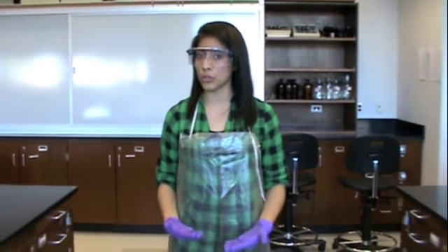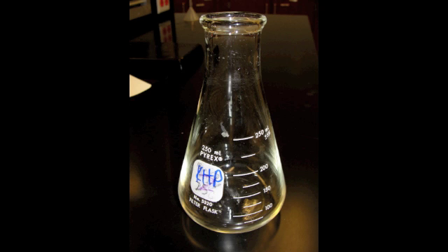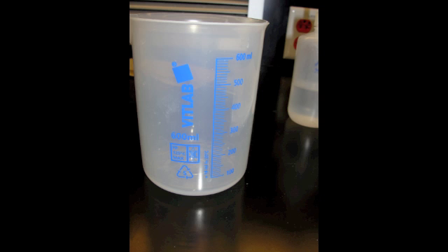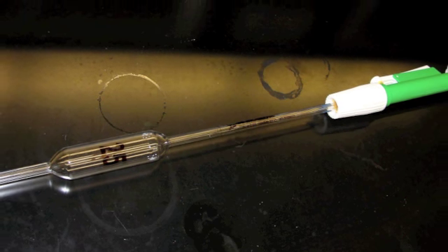So materials that we will use for this experiment are the following. Phenolphthalein, which serves as an indicator. It is colorless in acidic solution and pink in basic solution. You need Erlenmeyer flasks for your KHP and your vinegar samples. You need a burette with the ring stand. You need your vinegar solution as well as NaOH pellets to make your solution. You need a discarded rinse container and a volumetric pipette for the acid component. Make sure to rinse and cleanse with your vinegar solution.